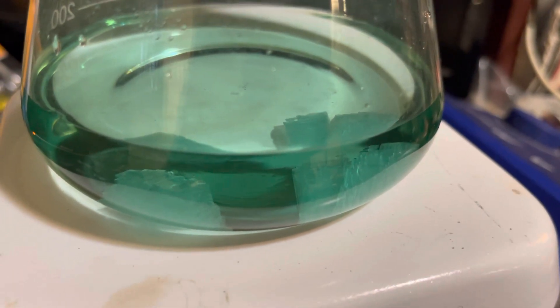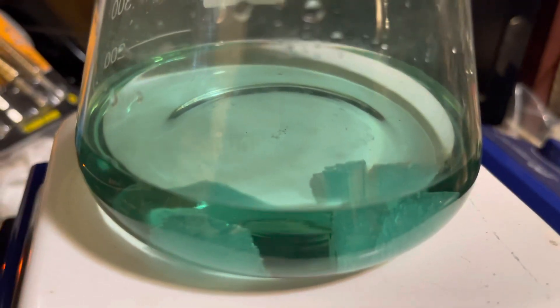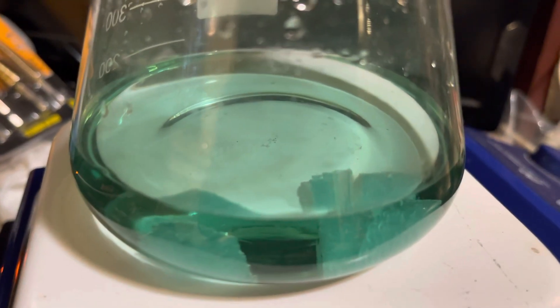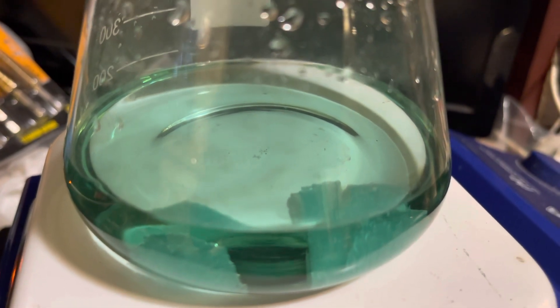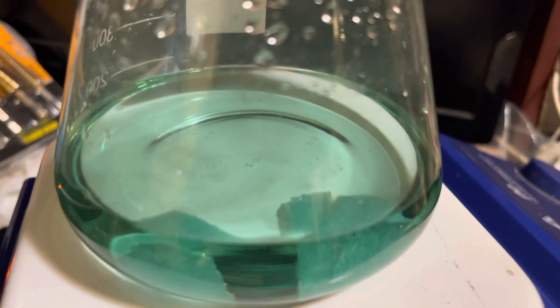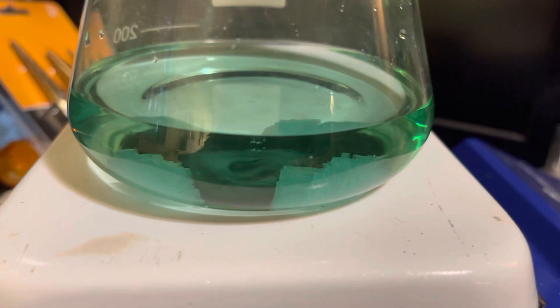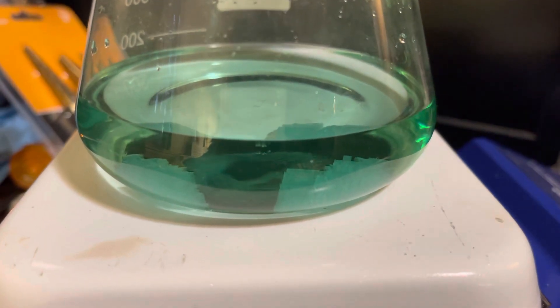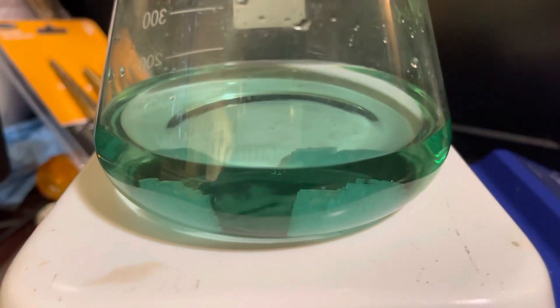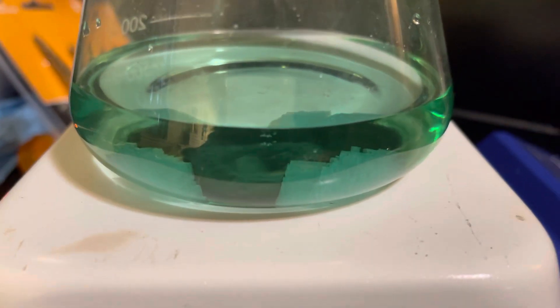Getting them out is going to be a different story. I'll probably just, after I open it up, flood it again with some more argon and then kind of break it up to get the crystals out. But I'm going to be making a batch of synthetic pyrite again, and I should have good results that I can end up with from forming this from start to finish.